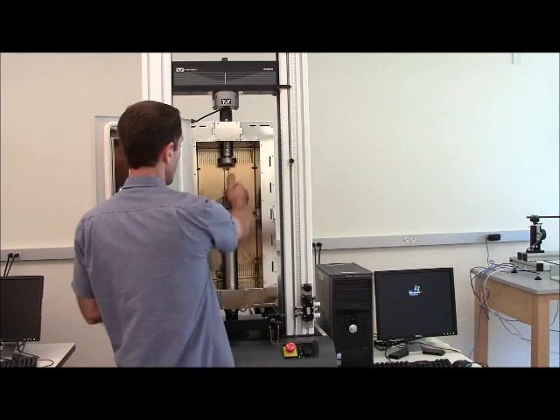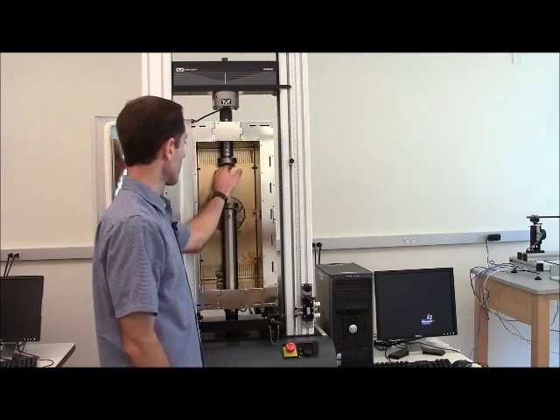So we're going to have to place spacers in there. Now those spacers can just be pieces of metal to get it up to the right height. You'll also have to do the same thing for the PVC. You'll need a much bigger spacer in order to get that up high enough. It needs to be pretty close.